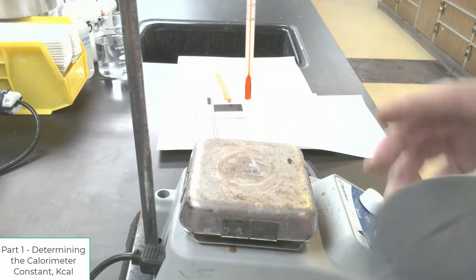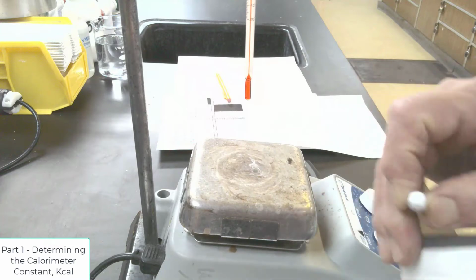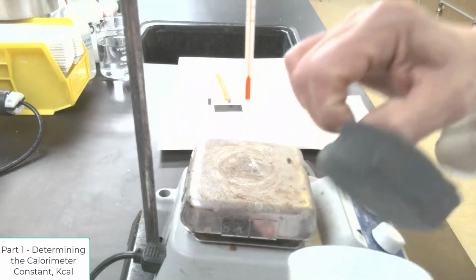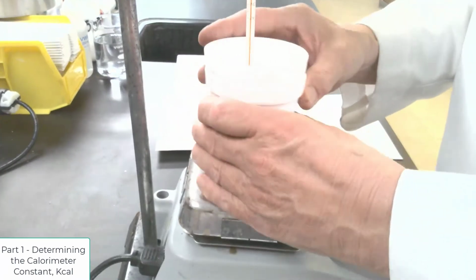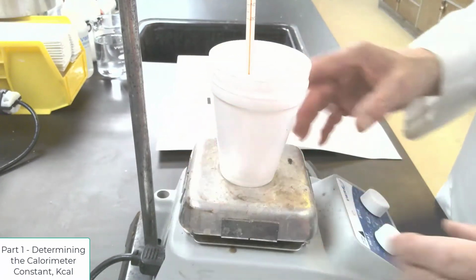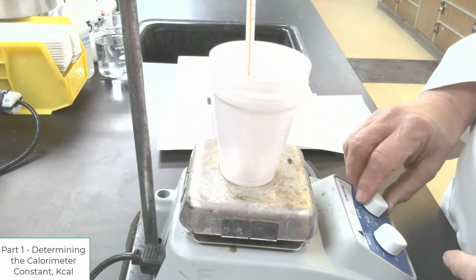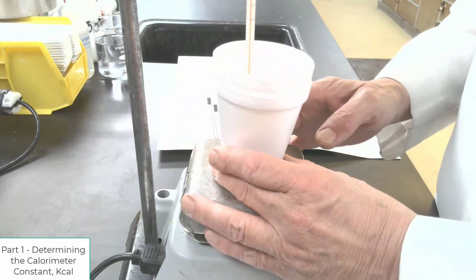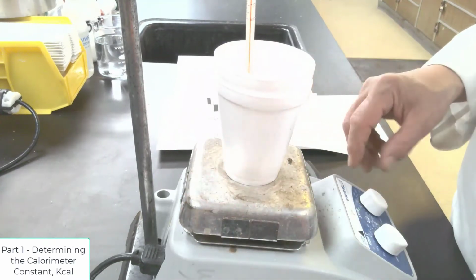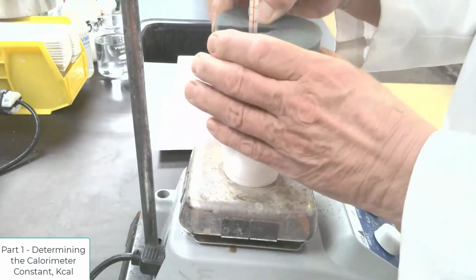Now this would be the setup. We put the water in here, we put a stir bar in, we put it on the hot plate. Now notice I've nested 2 cups together because that gives me better insulation. Then I will turn on my magnetic stir bar, and it's stirring. I will put on my samples in there. I put my cover on.